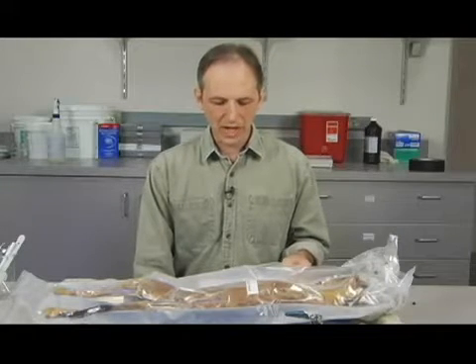In addition to using the cats, though, we're also going to use human models. And so between the cats and the models, I think we'll get a very good idea of the anatomical forms and the actual tissues that form the body. So that's kind of why we do that.